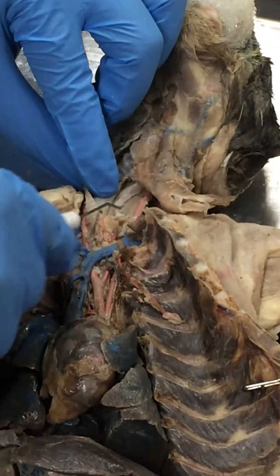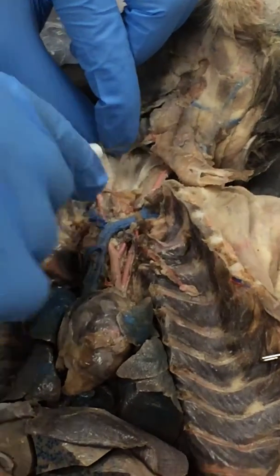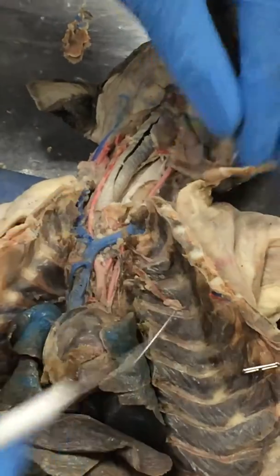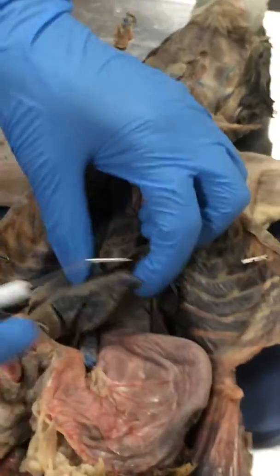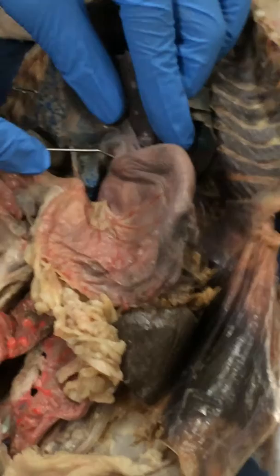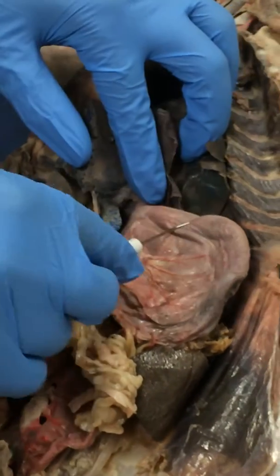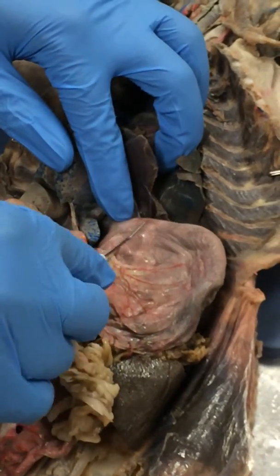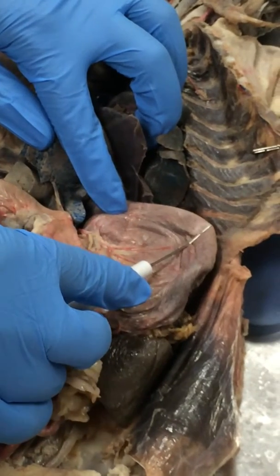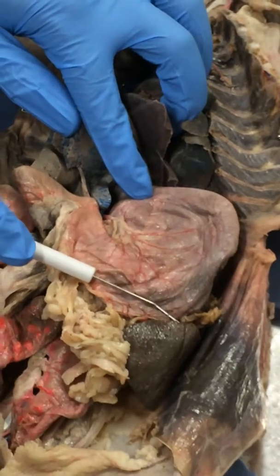Okay, below this, you have the esophagus, which is right here. This is the esophagus running inferior to the trachea. All right. Now coming down, crossing the diaphragm, you have the GES, or the gastroesophageal sphincter. Then after the gastroesophageal sphincter, you hit the cardia. And then after the cardia region, you have the fundus. Then you have the body and the greater curvature on the body.